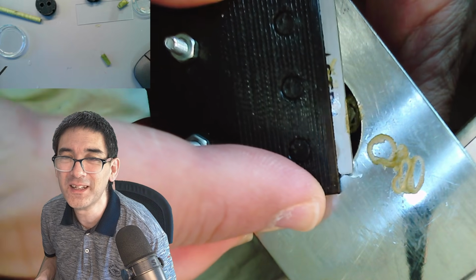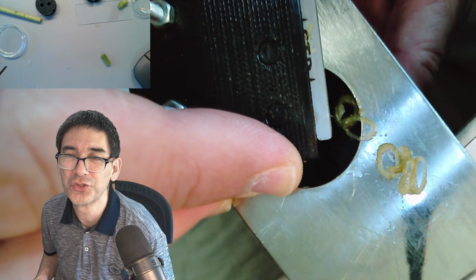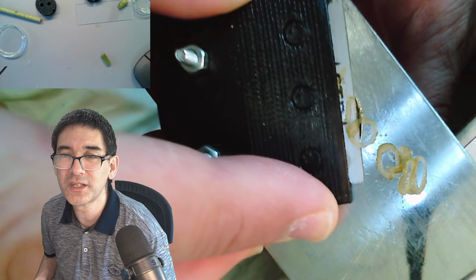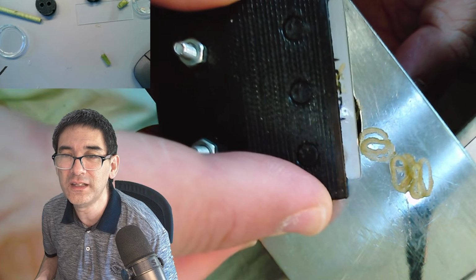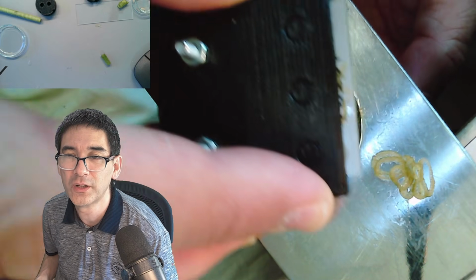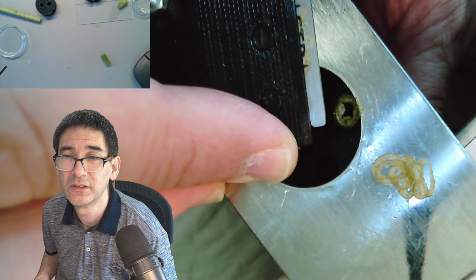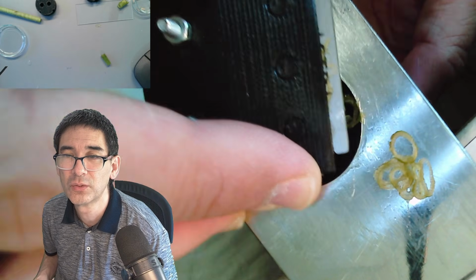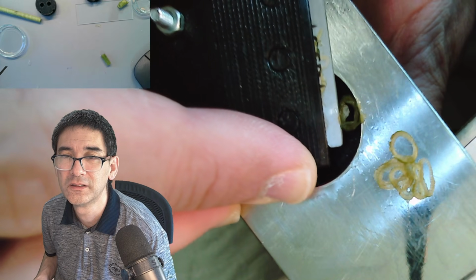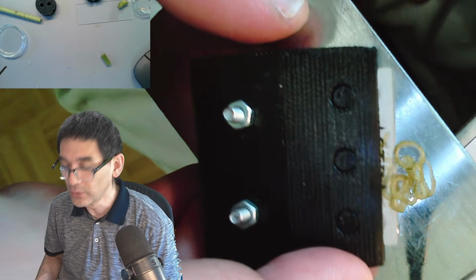But then again, maybe it's not completely frozen. It's kind of half frozen. This is not a new technique. There are indeed so-called cryo-microtomes, where you cut the specimen while frozen, so that is nothing entirely new. Okay, it's too thick again. I think I'm going to leave it at that.